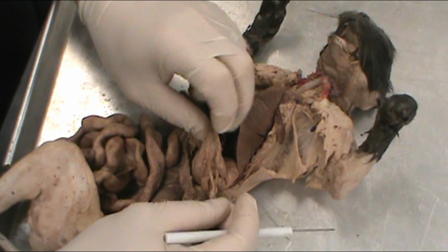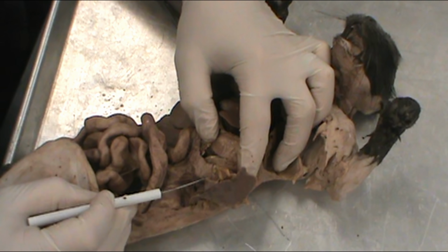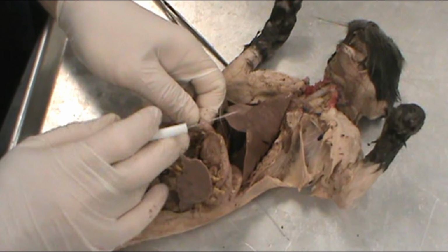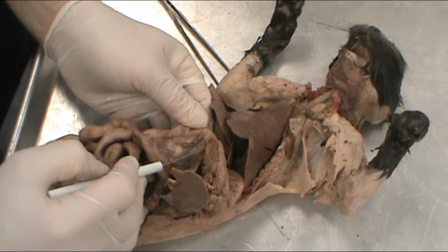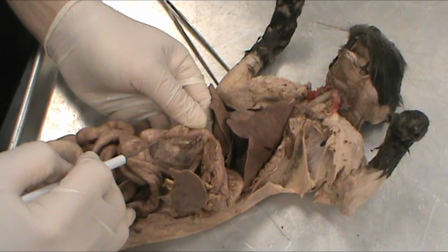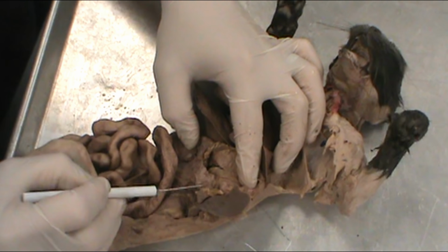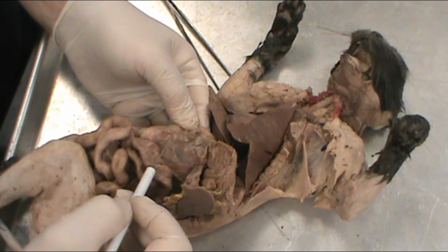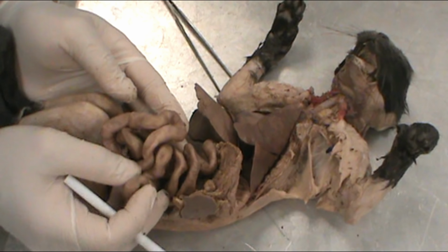And underneath the stomach, this mass of tissue that goes from the spleen underneath the stomach, and then we'll make a turn and we'll tuck in the very beginning of the small intestine right here. This material lined in the mesentery is the pancreas. And if we can see that as it goes from here down and rides right along the underside of the small intestine. Again, that would be the pancreas. So all of this tissue here would be small intestine.